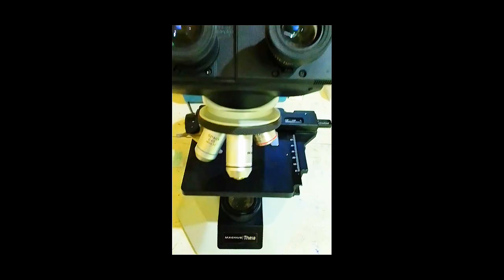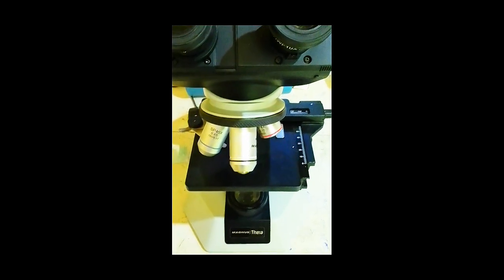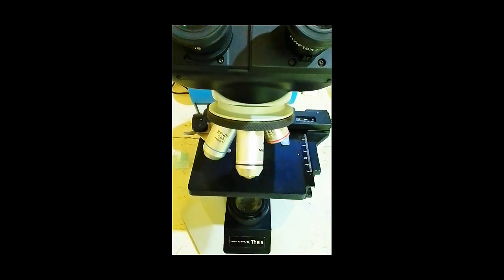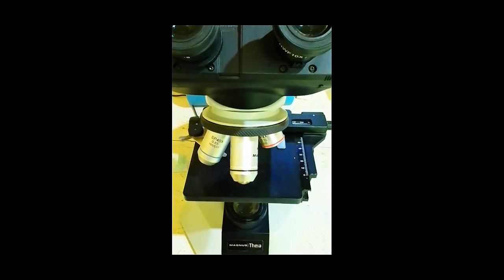2. Microscope. A microscope is a device used to magnify very small objects that cannot be seen clearly with the naked eye. It helps laboratory professionals examine cells, microorganisms, and other microscopic structures for diagnosis and research. Uses of a microscope in a medical laboratory.